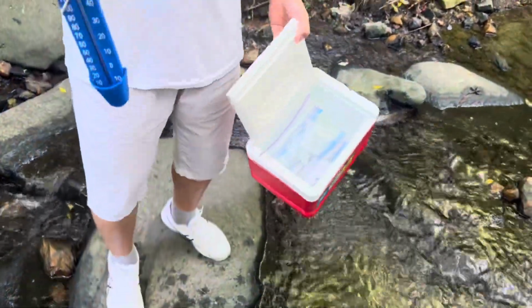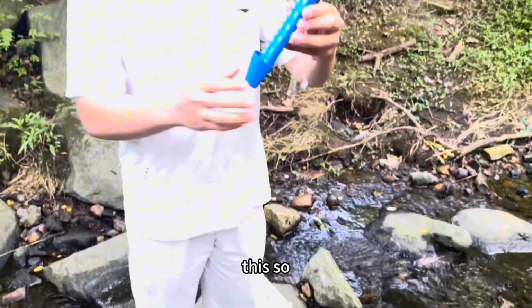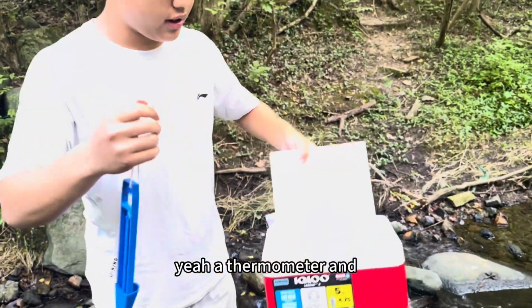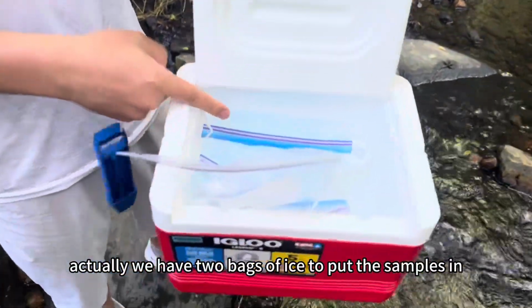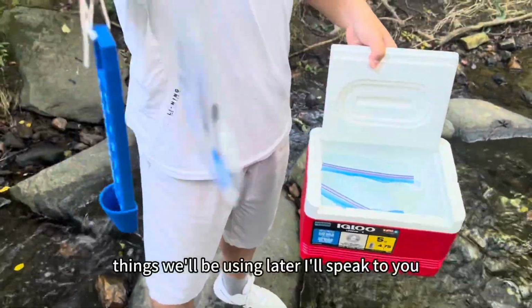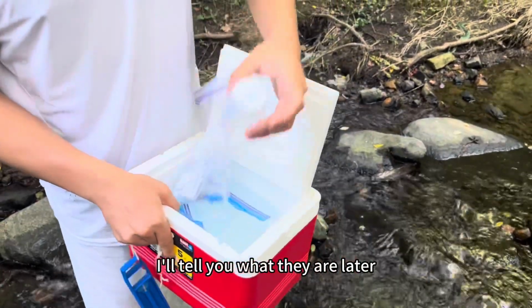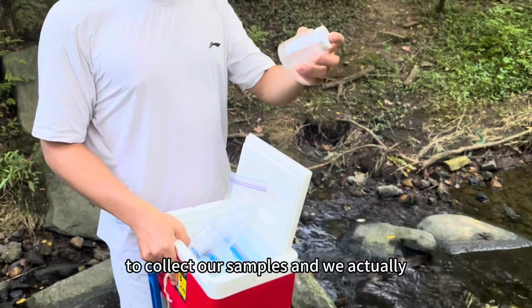First of all, we'll start with this, a thermometer. We have 2 bags of ice to put the samples in, and a bag of things we'll be using later. I'll tell you what they are later. There are 2 bottles to collect our samples.